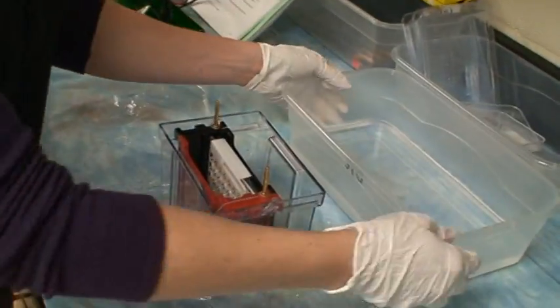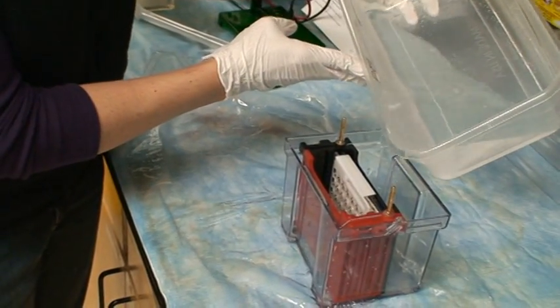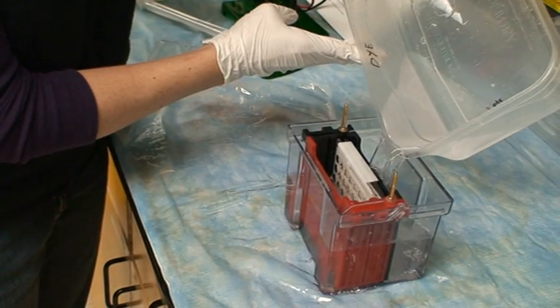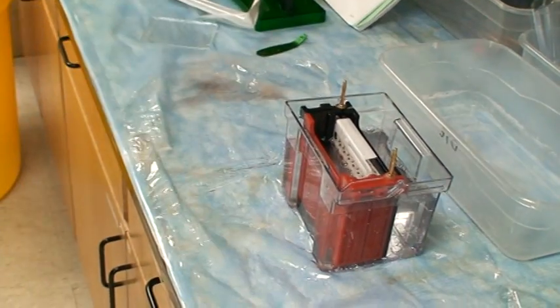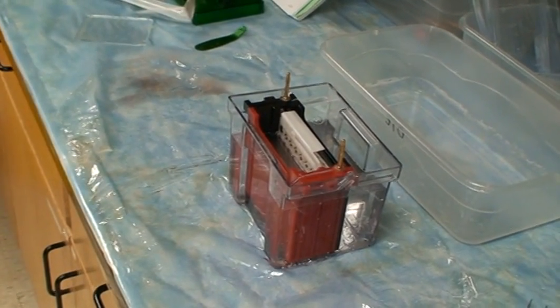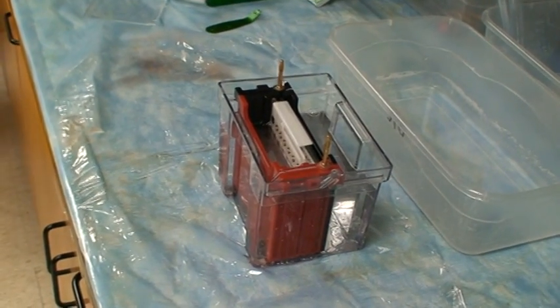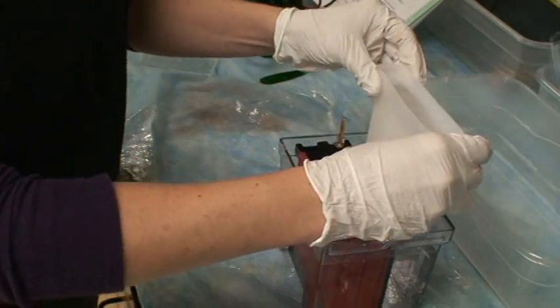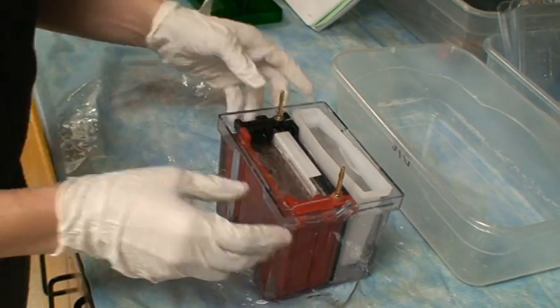This is my transfer buffer. I'm going to add that. And then I'm going to grab an ice pack. Don't turn it off. And you place the ice pack in the open portion. Fits just about perfect.